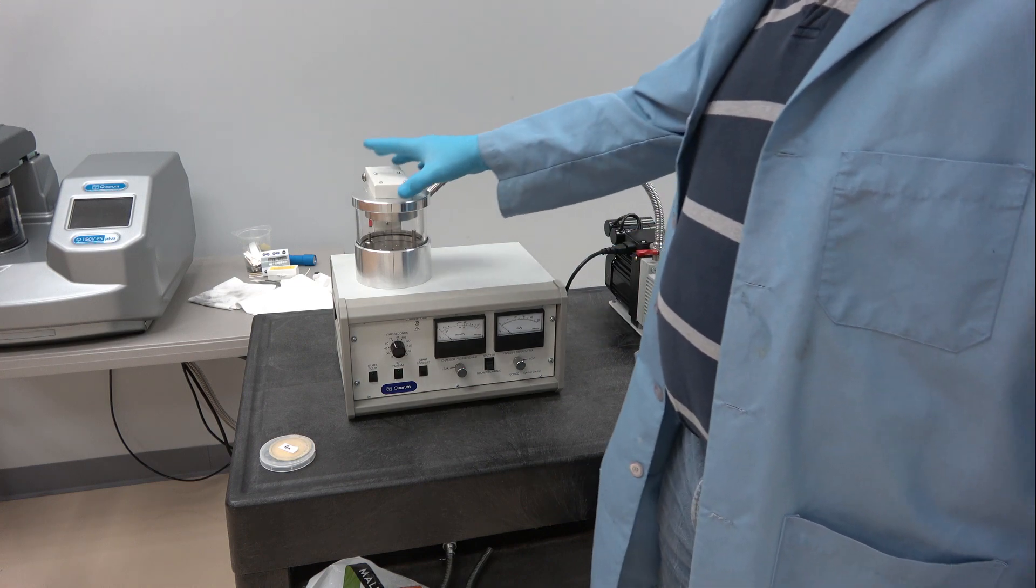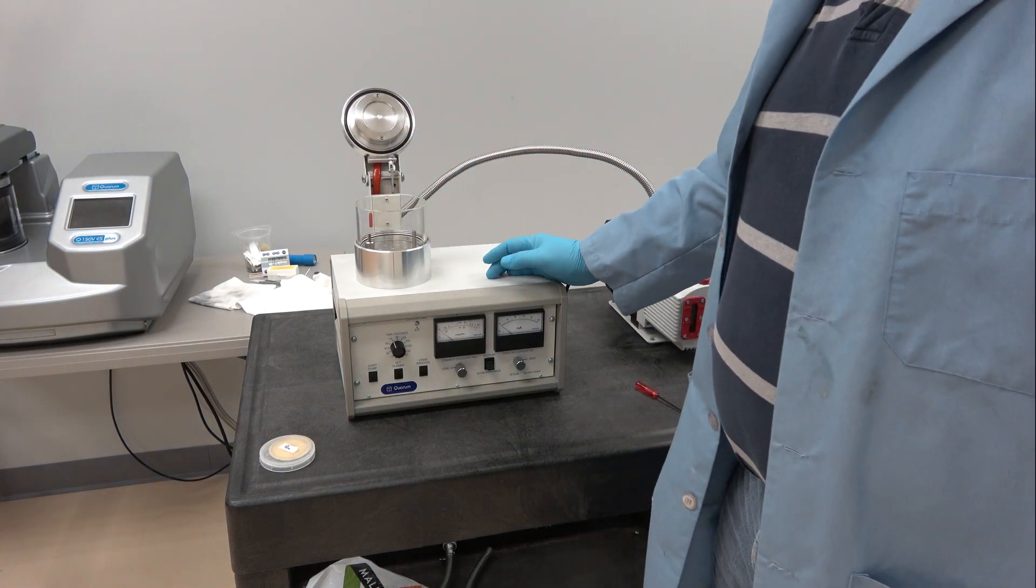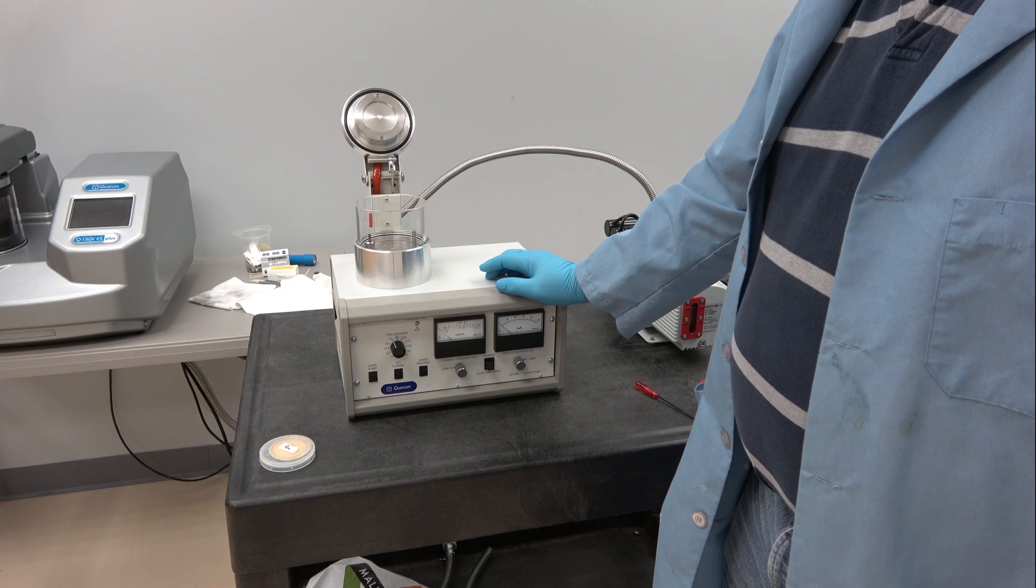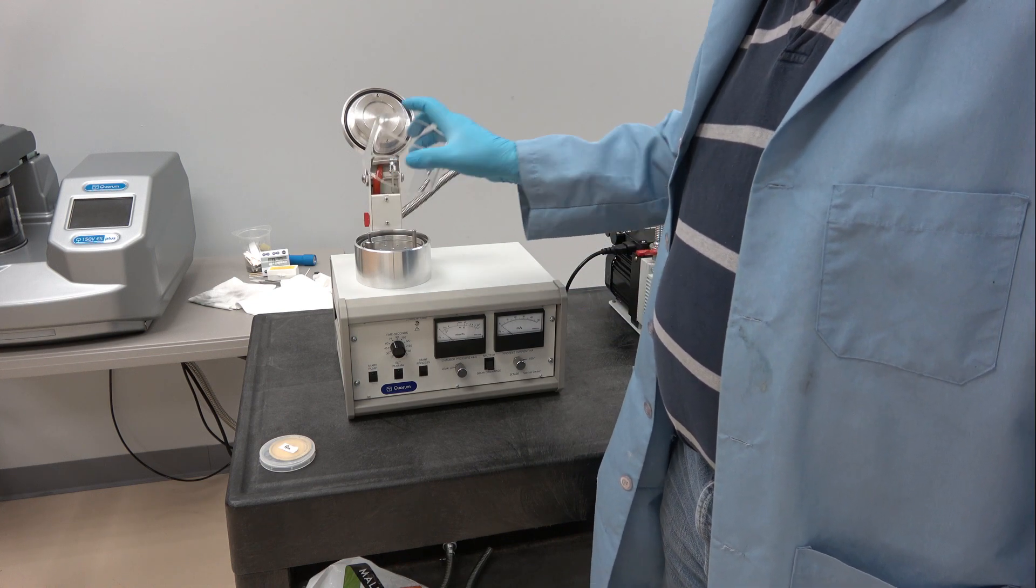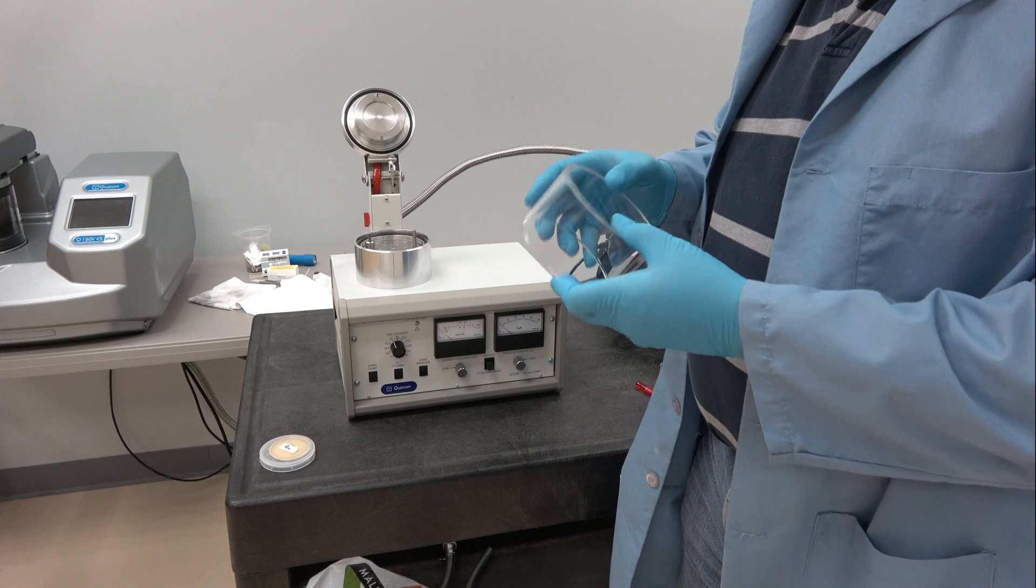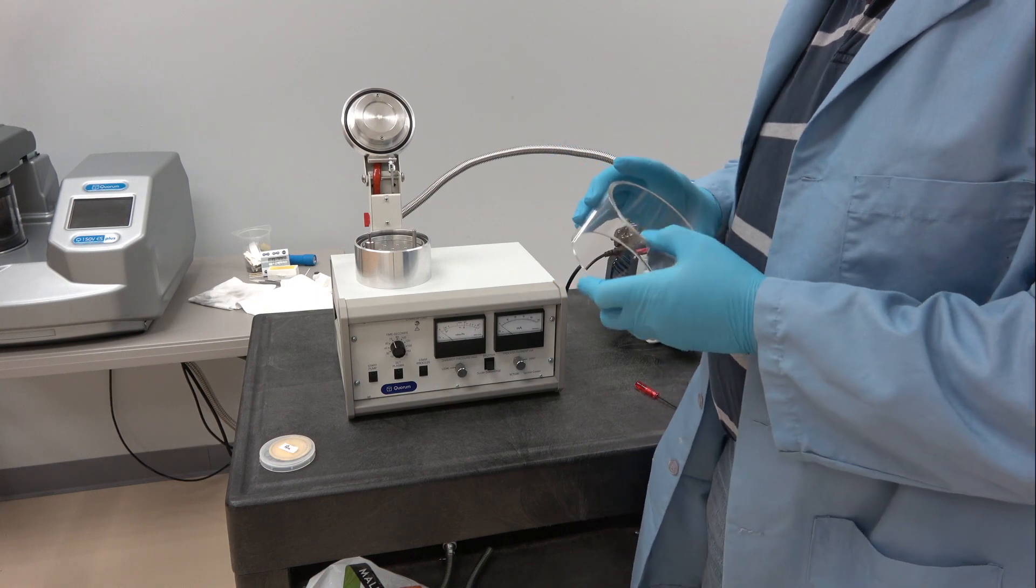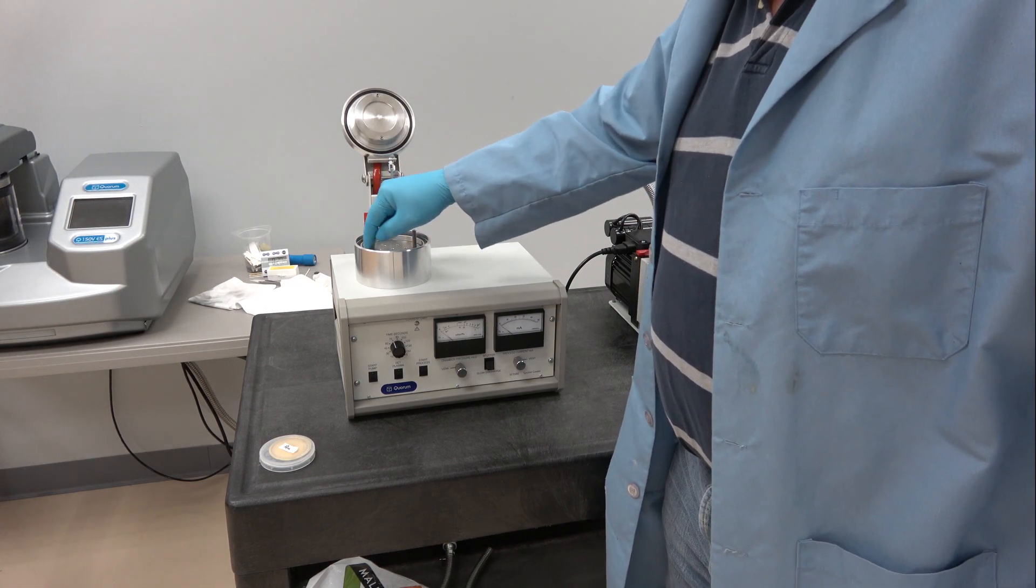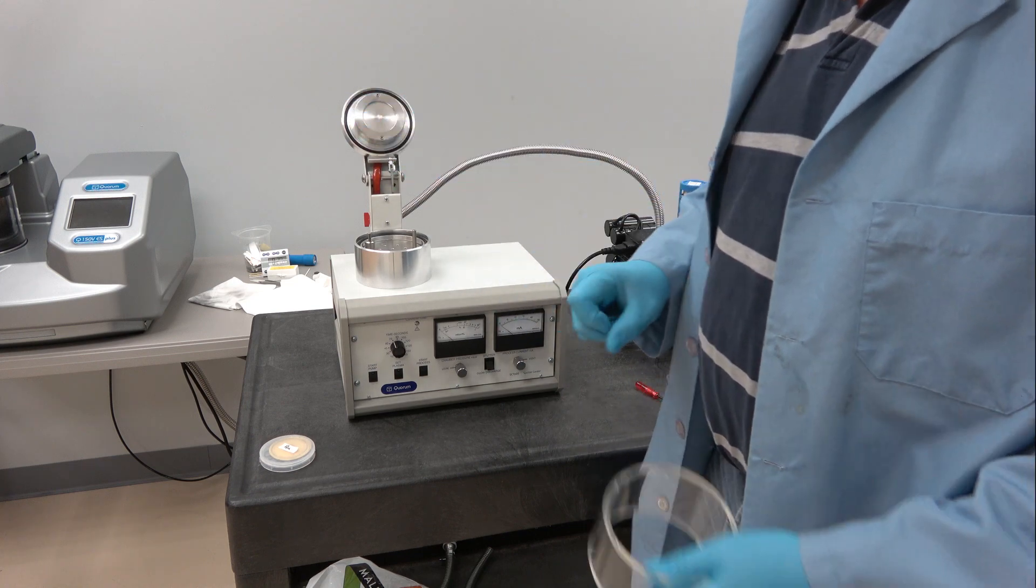So let's have a look inside the chamber. And let me show you how to install the target. That seems to cause a great deal of confusion. It's always good to wear gloves so you don't put your fingerprints all over the inside of the chamber which slows the pumping sequence. It's also very good to make sure that the O-rings here are dust and dirt free.